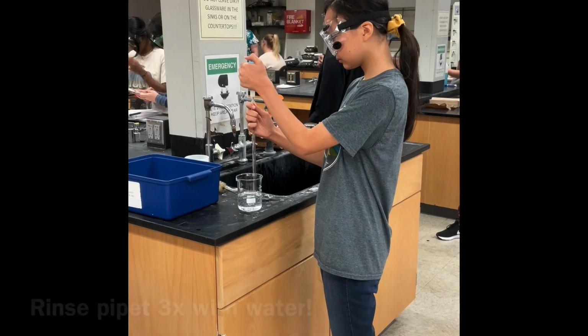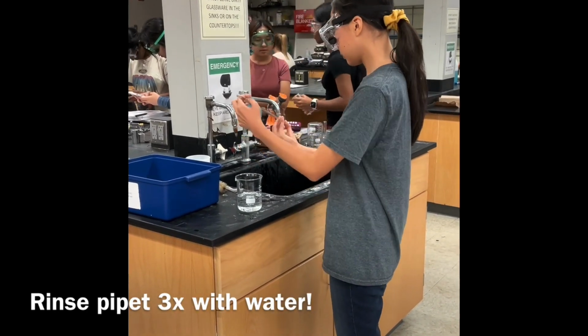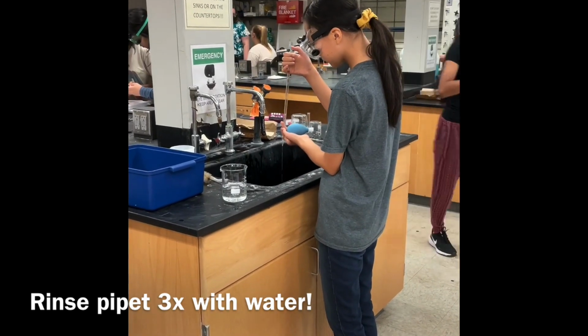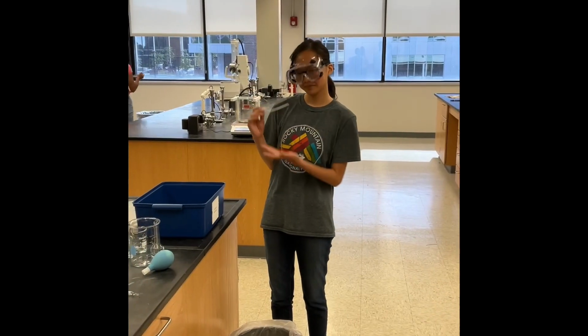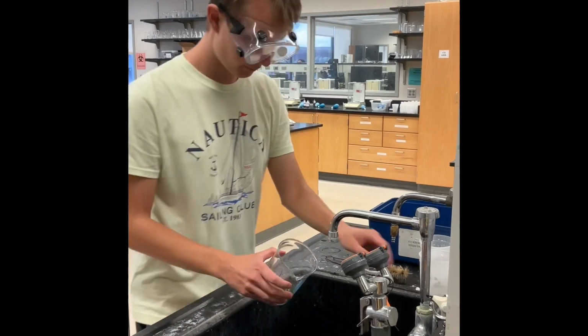After the experiment is over, we begin the cleanup process. First, we properly dispose of the solutions down the drain after checking with our lab proctor about the appropriate disposal method. It is important to note that not all solutions can go down the drain, and some must be disposed of in their proper chemical waste containers.